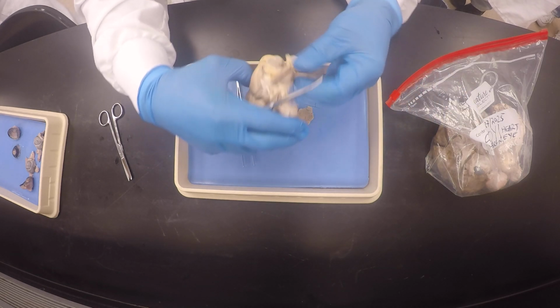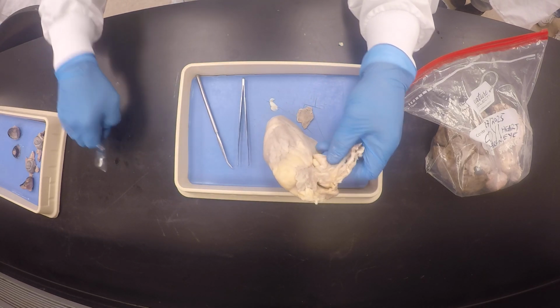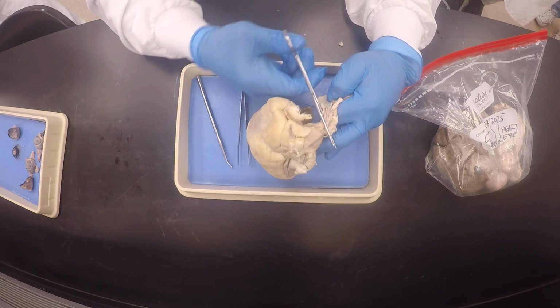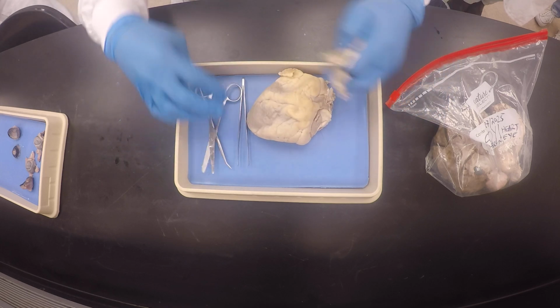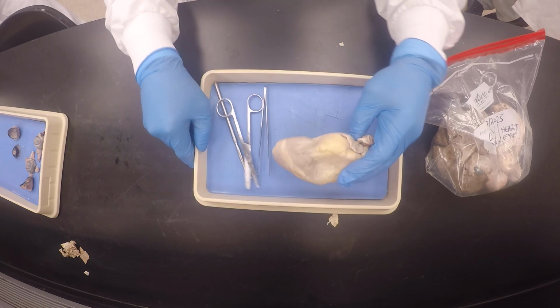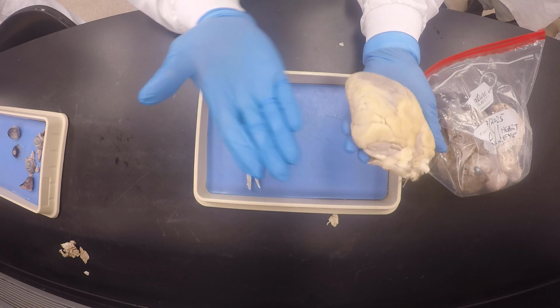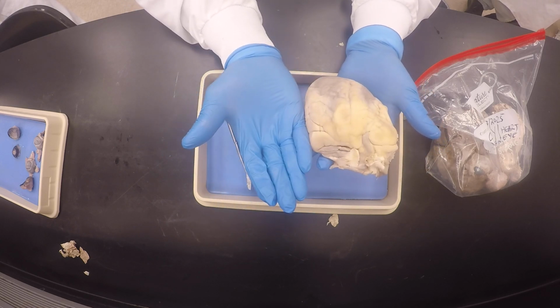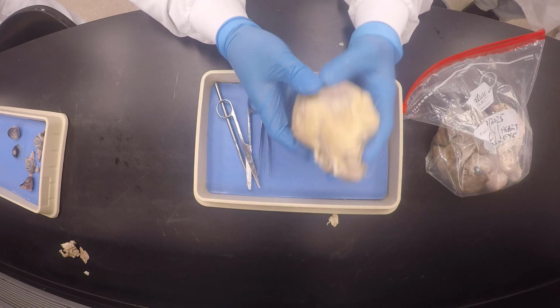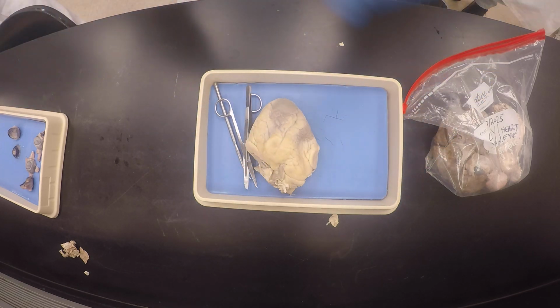So I'm going to cut this off a little bit, just so that my heart is not too busy, so that I can play with it a little. Make sure I'm not cutting through my straps. So what I'm doing now is cutting from this end, from the left ventricle towards the right. I'm going to leave it hanging by a bit of the right ventricle. You understand? So I can open it like a page like that. It will look like a butterfly.